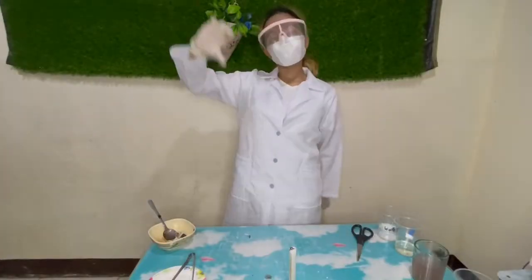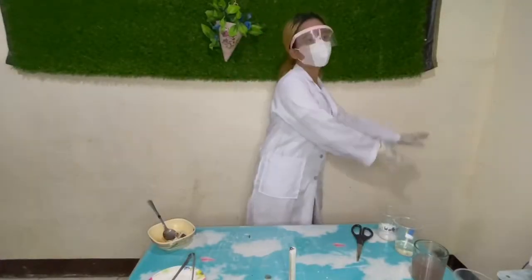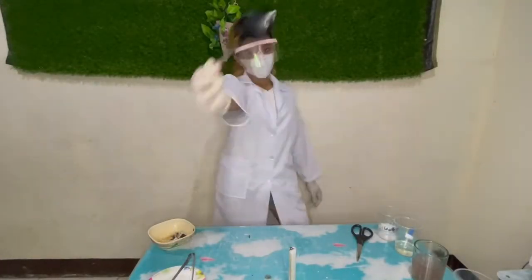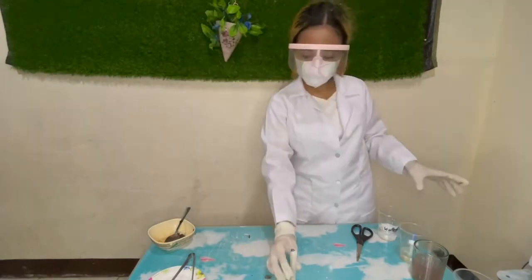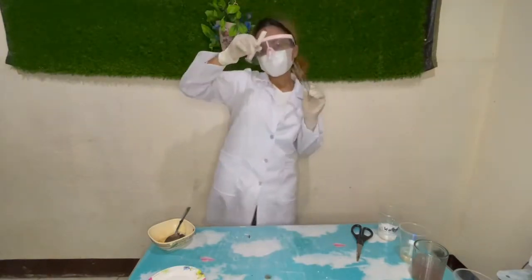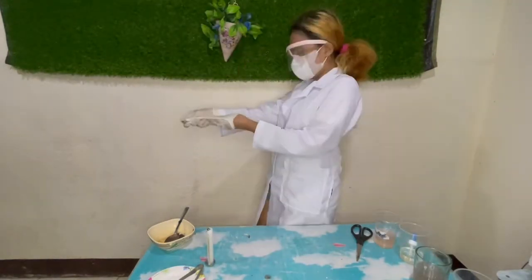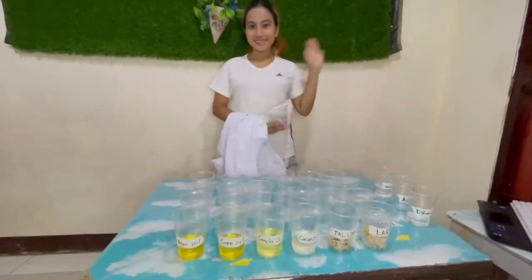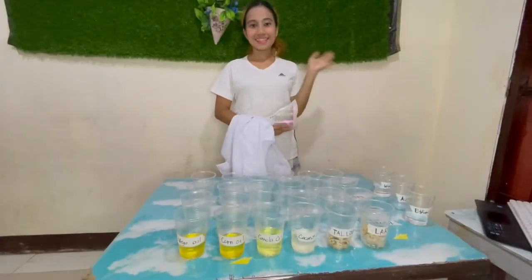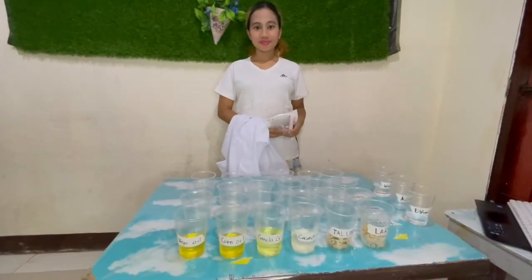Hello universe! So in this vlog, we're going to experiment and learn about fats and oils in biomolecules. I'm a little bit excited — let's go! By the way, I'm a 1st year BS Bio student.